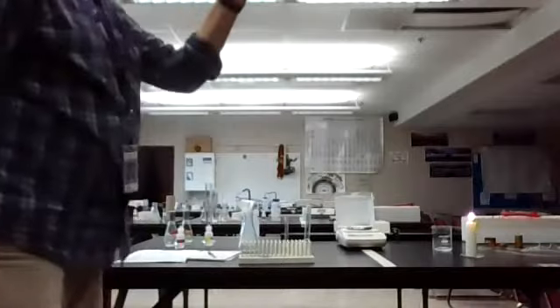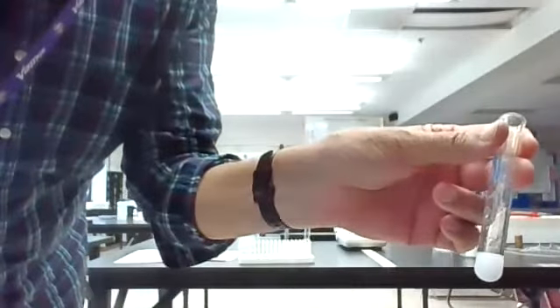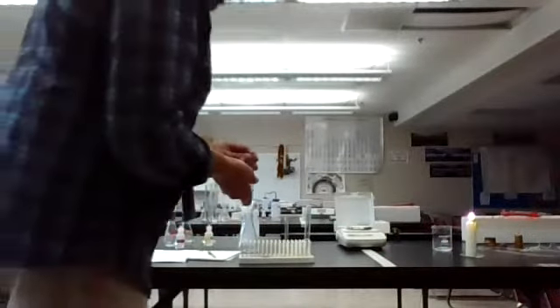So what I'm going to do is something you're going to notice if you look really carefully at this. Hopefully you guys can see that. At the bottom, there's that little white powder, it looks like, that collected. That is the precipitate. Precipitate is what happens when we mix two liquids together and we get a solid forming at the bottom. It falls out of solution, we say. Precipitate. Okay, we have precipitation.